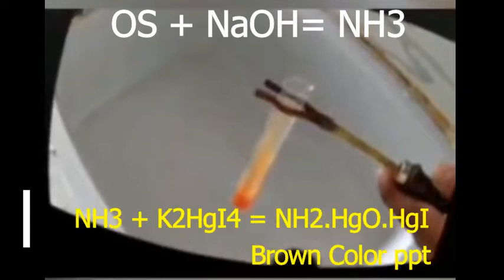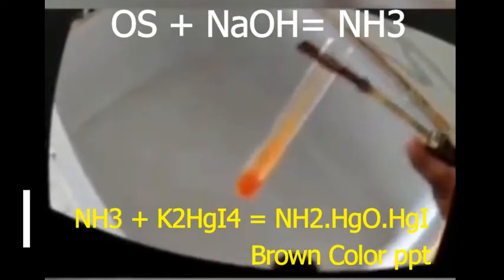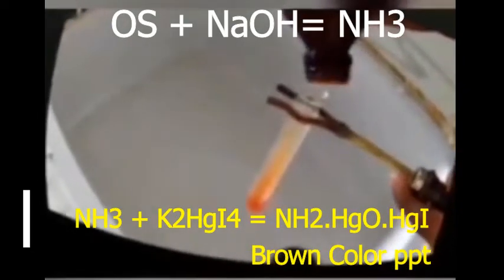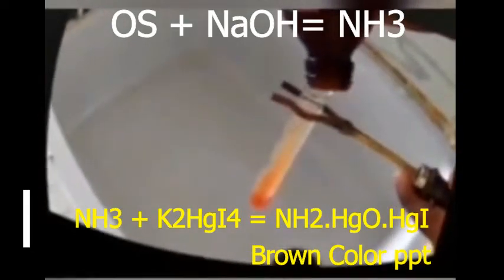This Nessler's reagent is K2HgI4. On reaction with the evolved ammonia, it turns brown, and the complex formed is NH2·HgO·HgI. This is very important from the Viva point of view.